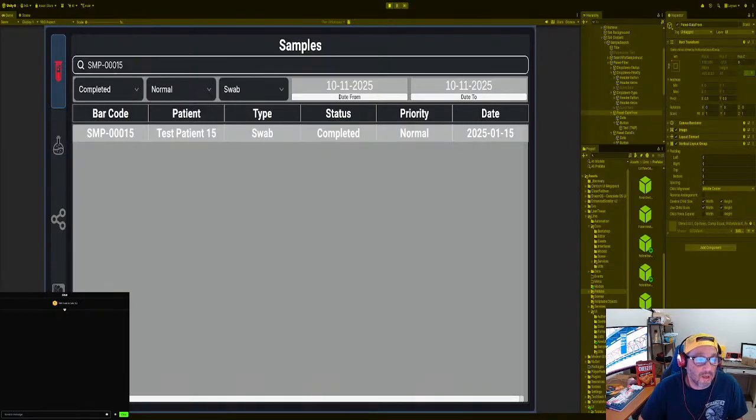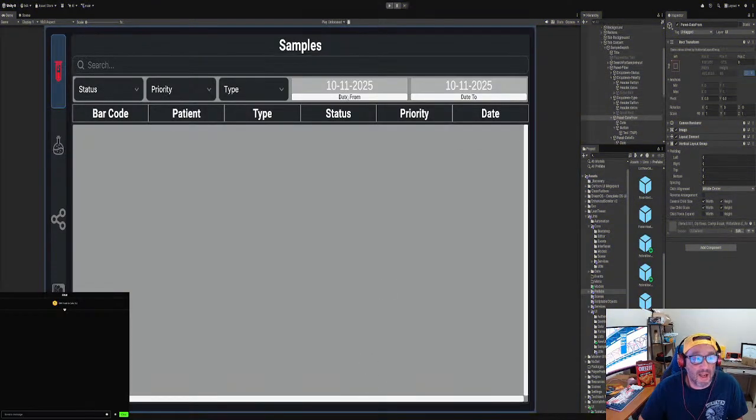All right. So yeah, that's working. So now the tricky part, right? We set the date as a string. The plugin that we use, the Evo UI, uses a calendar, which is really cool, and I wanted to use that. So I'm gonna combine that with the modern UI, which has a movable window, which most people would prefer, especially when the screen is a different resolution. All right, so that's what we're gonna do now.